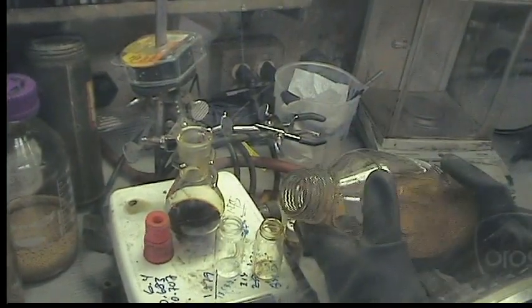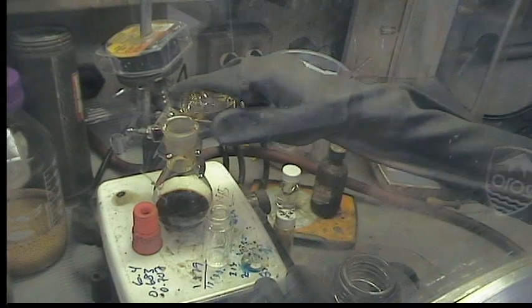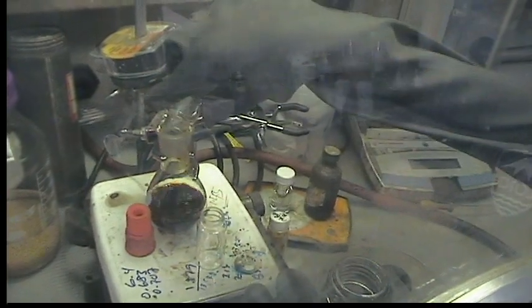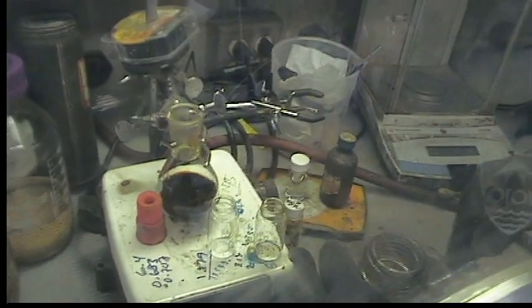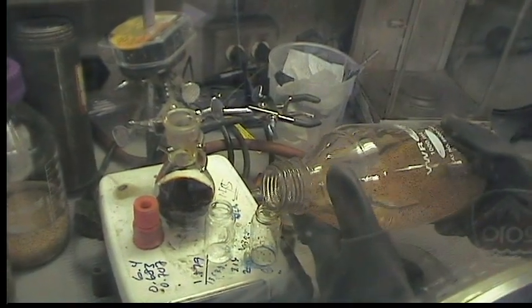So the sodium P3-niobium complex changes color? When THF is added, it darkens to more of a red-orange from a yellow-orange, and that's consistent with when you crystallize the fully THF-solvated P3 anion — it's much more of a red color.